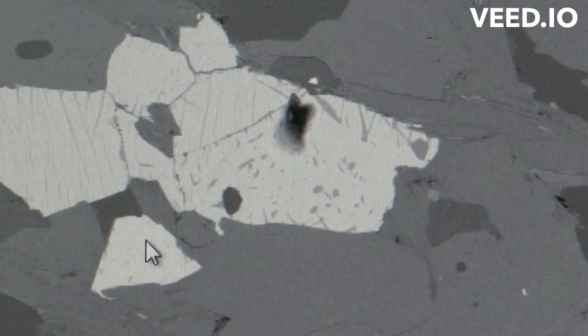Backscattered electrons are high-energy electrons used to obtain high-resolution images that show the distribution of various elements that make up a sample. When the sample is bombarded with electrons, some of the negatively charged electrons won't be captured by the pull of the positive nucleus. Instead, they'll be reflected or backscattered out of the sample. Backscattered electron imagery is always in grayscale and the color is based on the weight of the elements within the minerals. The heavy elements exhibit light color whereas the light elements will exhibit dark colors.